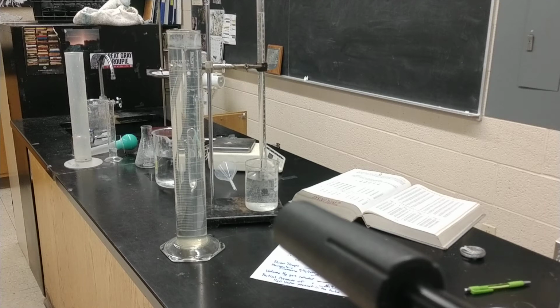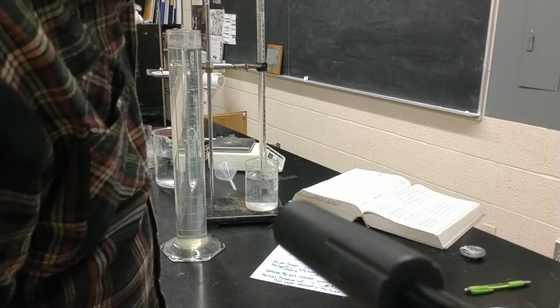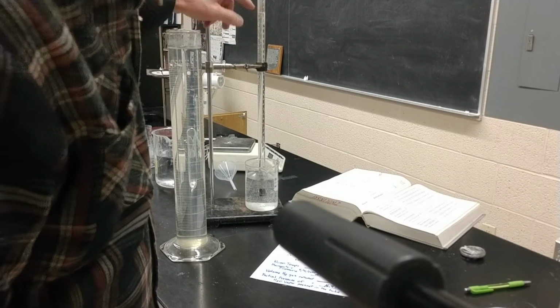So it looks like the magnesium ribbon is now completed and all used up and has converted a hydrochloric acid with some hydrogen gas as one of the products in a single replacement reaction in the gas tube. So what remains for me to do is I read this volume at 32 milliliters from the top to here is how much hydrogen gas I have in there.